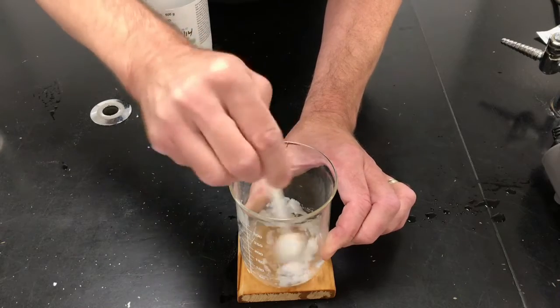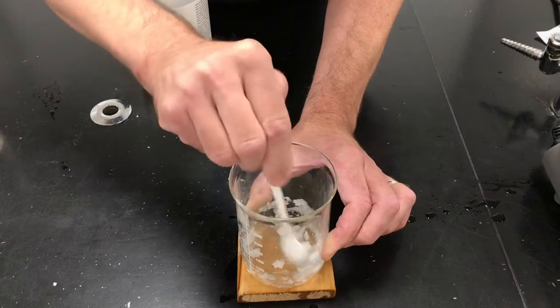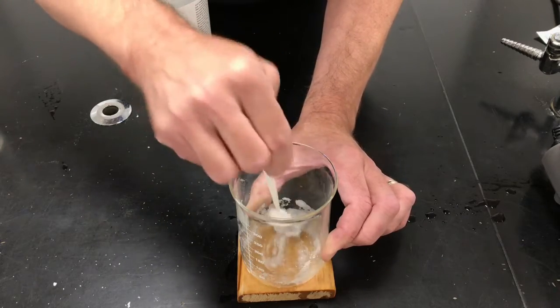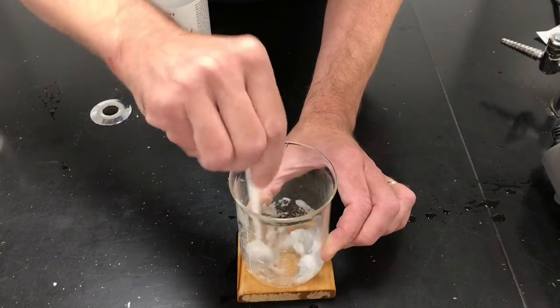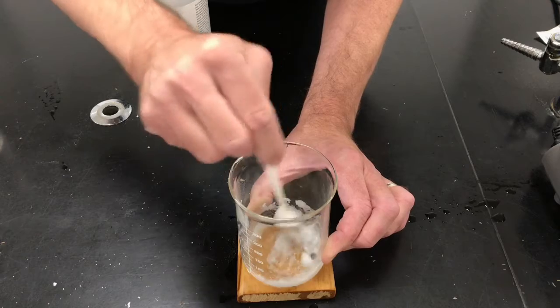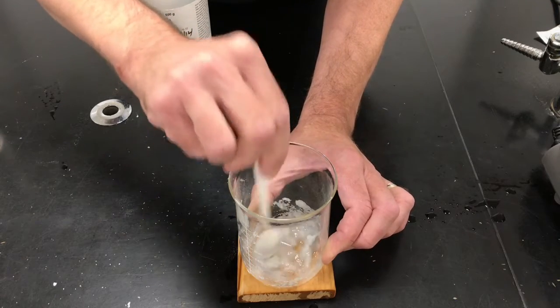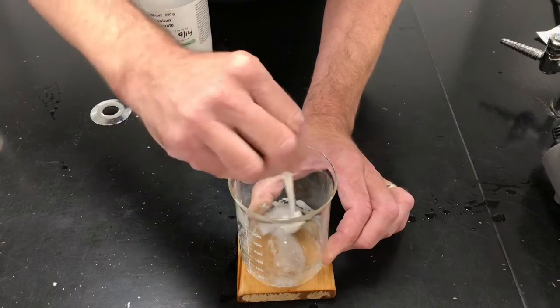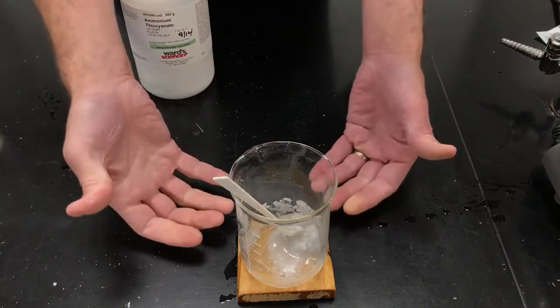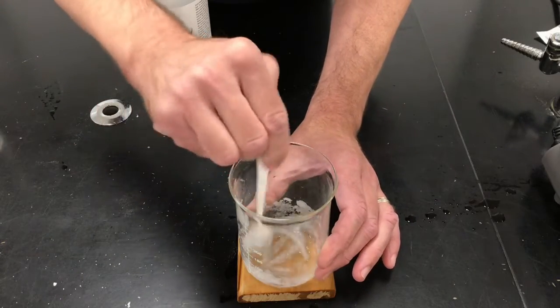But remember, there was no water in there. I'm also getting an odor. Now you can't sense that odor because you're at home, but I'm getting a smell of ammonia. I don't know if you guys know that ammonia smell from cleaning products. Look, it's getting real slushy in there. Real slushy. But that water was not in the beaker. And secondly, the water's not traveling through the glass of the beaker. That's not happening.